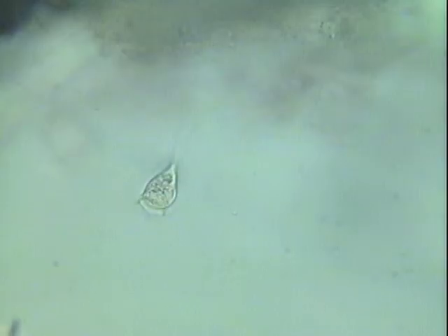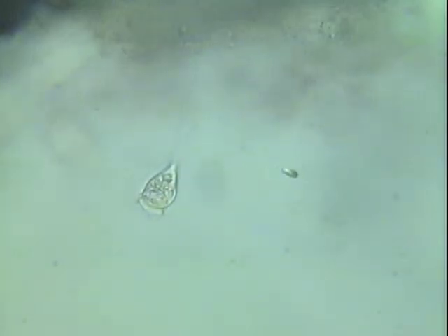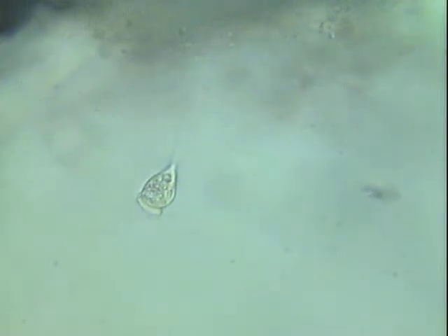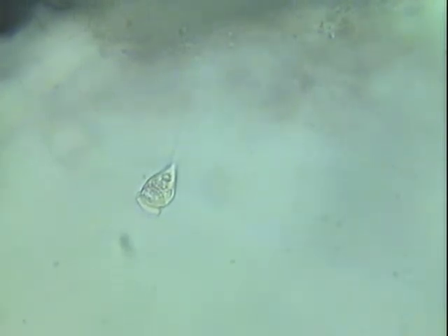It didn't like that big one that went by, but it's still captured by the current — by the vortex — and pulled into it.